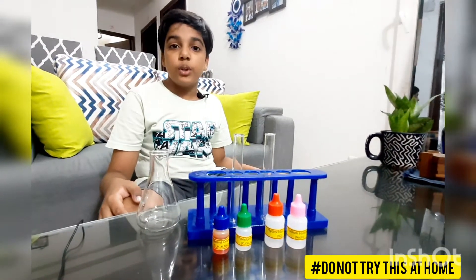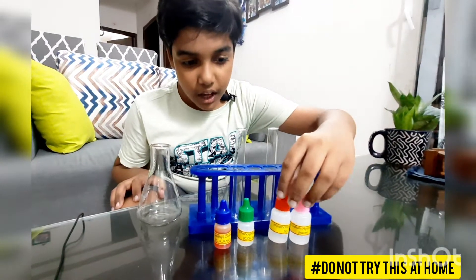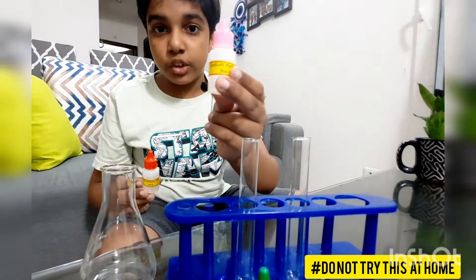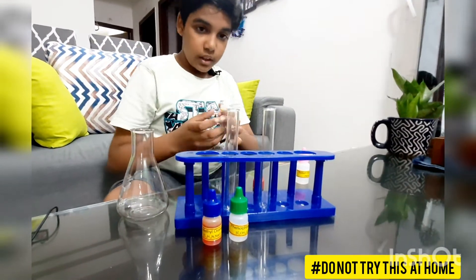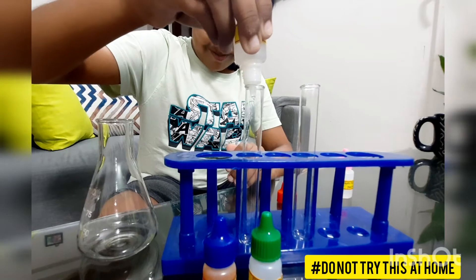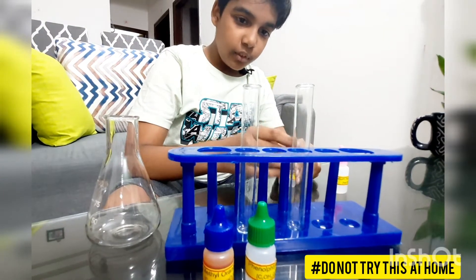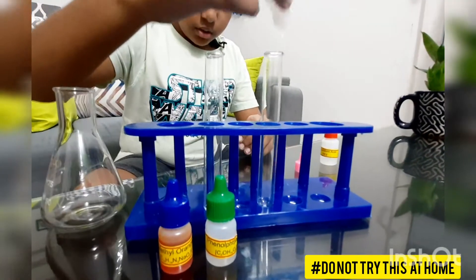Hi guys! Today I am going to show you a neutralization reaction and phenolphthalein indicator. For this I'm going to take two chemicals: one is hydrochloric acid and the other is sodium hydroxide. In the first one I'm going to put some hydrochloric acid, and in the other one we're going to put some sodium hydroxide.